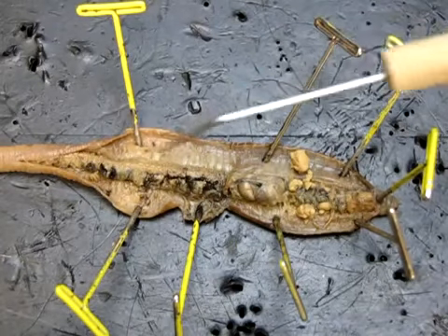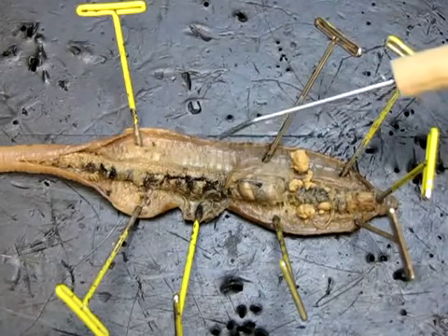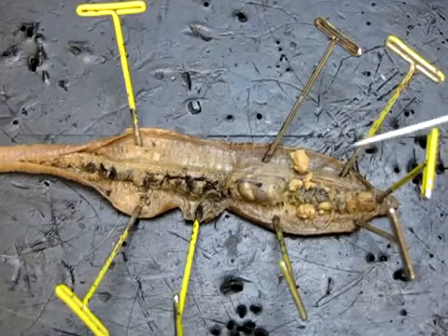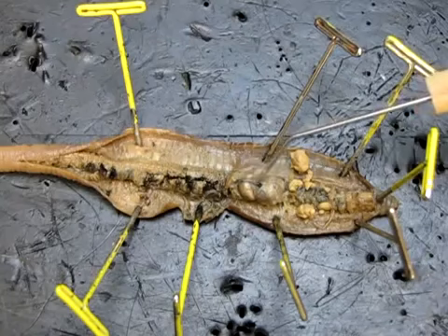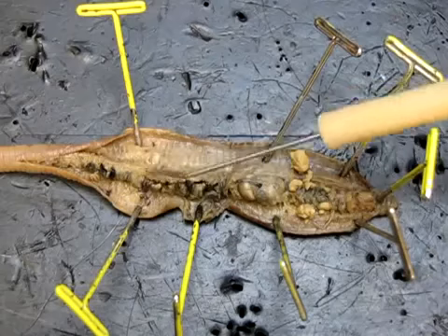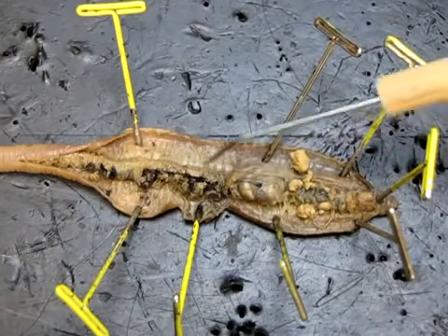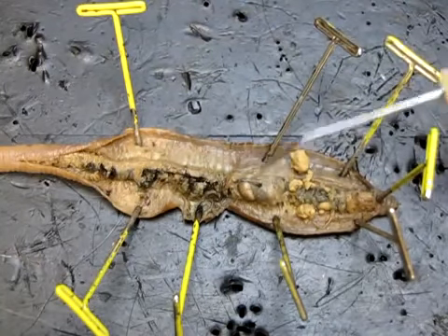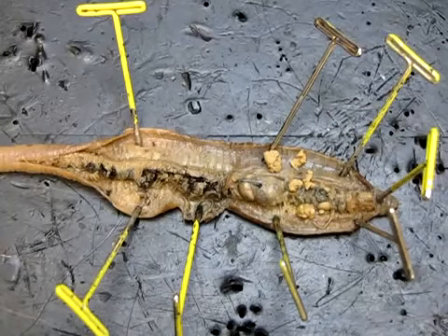Now, the other structure you may have noted, when you were positioning this animal before doing the dissection, you were asked to lay it dorsal side up so that you wouldn't cut the dorsal vessel, which was that dark line running down the exterior that you could see. We can actually see a nice section of the dorsal vessel right here, that little dark line there, and it does continue on. See if I can find it. I've probably cut it there, but this dorsal vessel carries on the entire length of the body, and that's the main blood vessel running down the dorsal surface. There's a similar vessel on the ventral surface, so underneath, that's called the ventral vessel, okay?